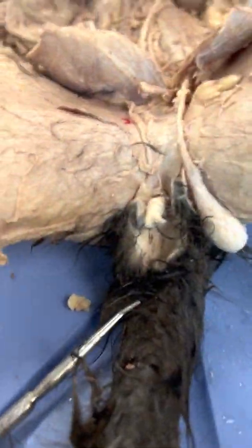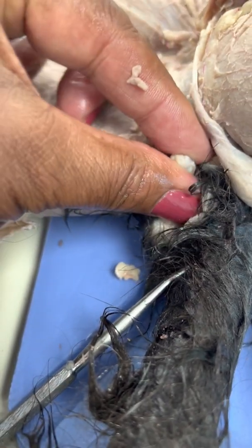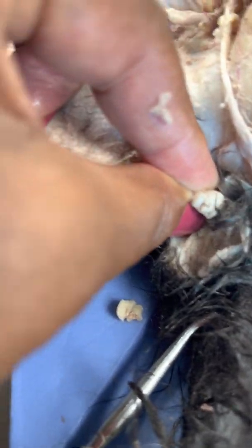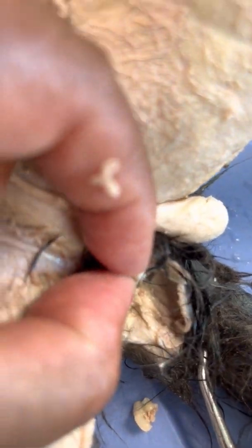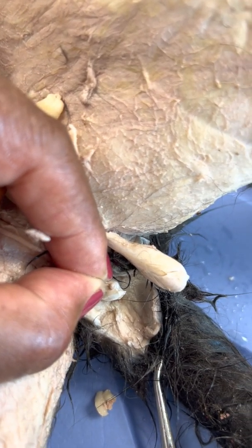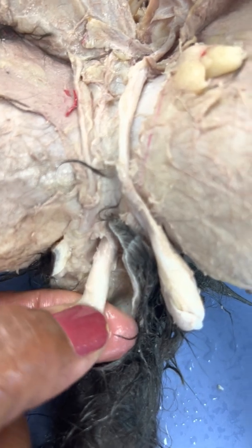So also, we were able to expose the penis, and just normally, you just see this little brown piece here. And I'm showing when you're looking at the cat, that's usually all that is exposed. It's just that little part, okay, right there. But you can see once we've taken it off, you can appreciate the whole length of the penis.